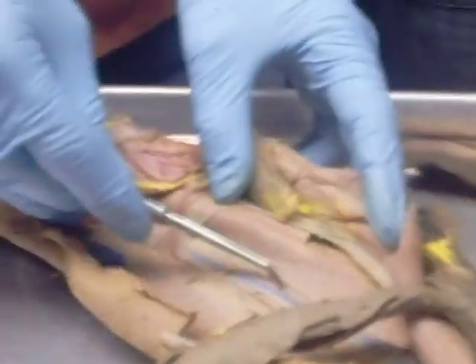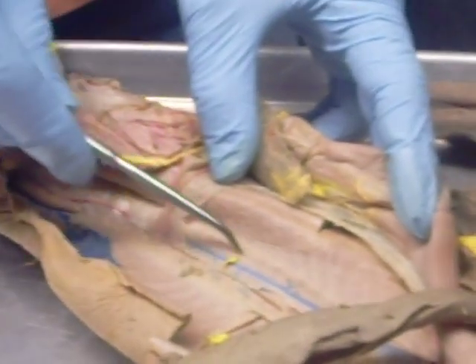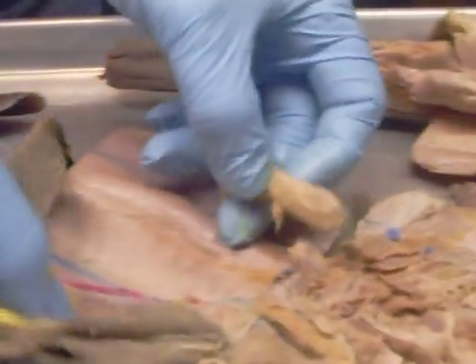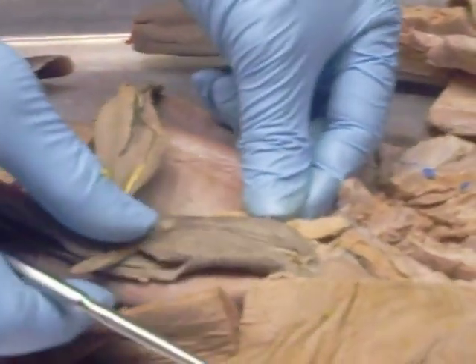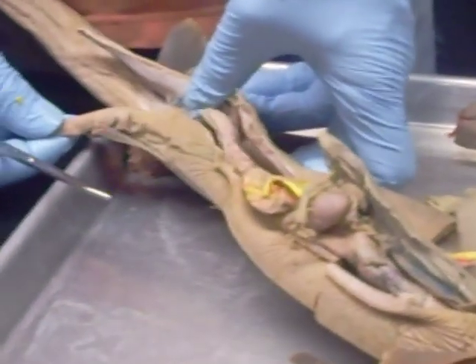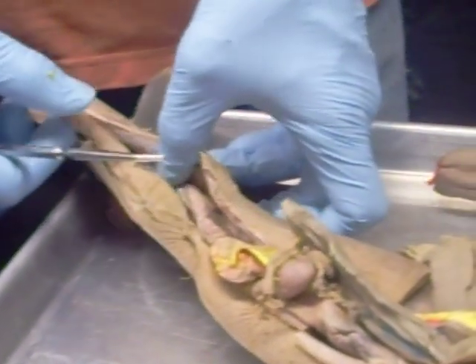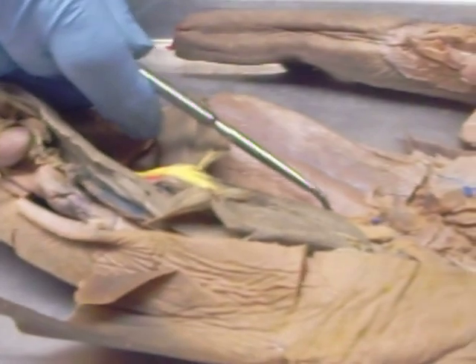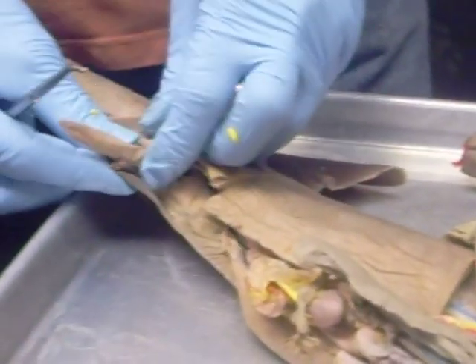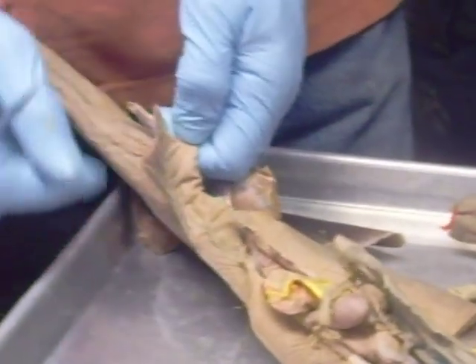In terms of the urinary system, it's up here. The mesonephric duct is up here. This is the mesonephros, so you can call it the kidney. In terms of reproductive system, this which isn't attached anymore but should have been attached right about there is a testis — I know it's a testis because it has claspers, which makes it a male. When you're doing the gonad, do mention whether it's a testis or an ovary by looking at the claspers to see if you have a male or a female.